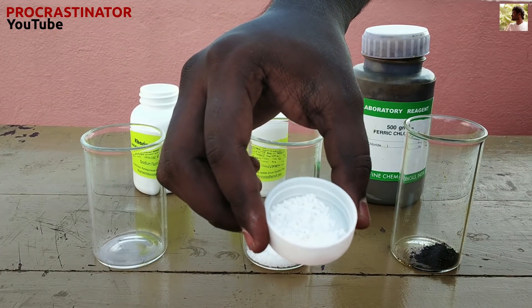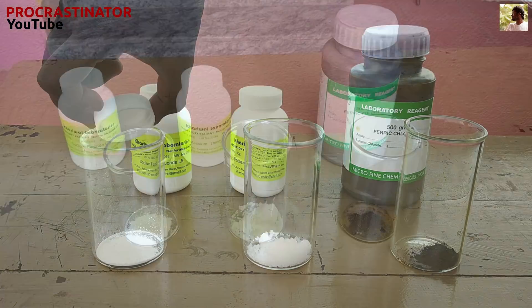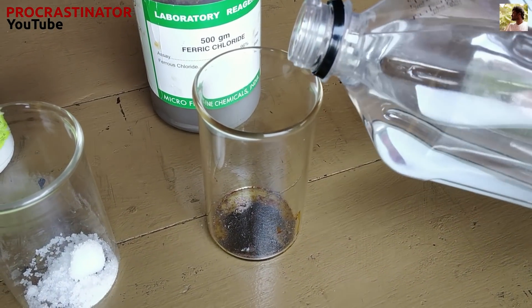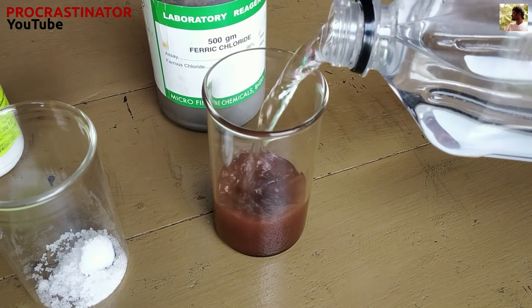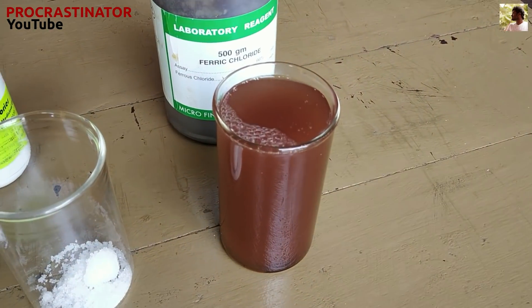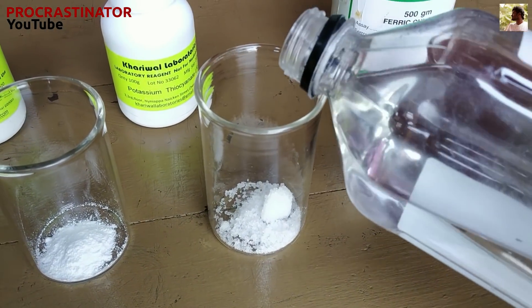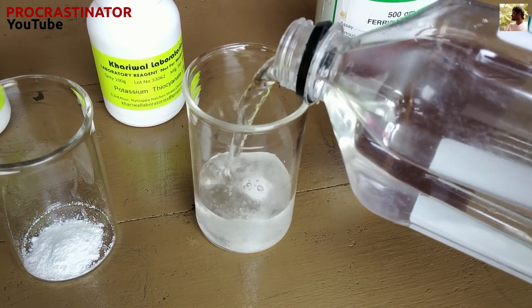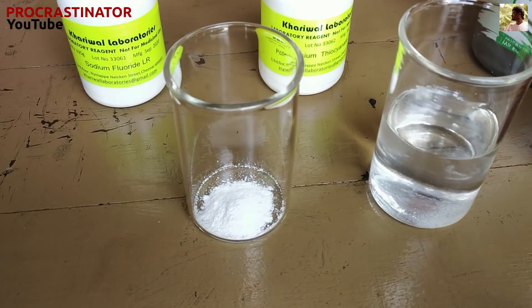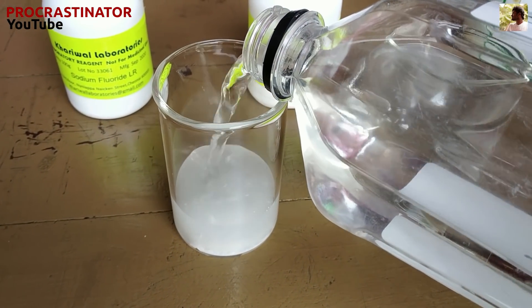Let's add to 3 containers. Let's add these containers. Let's put a few molecules in the first container. We'll put the ferric chloride and potassium thiocyanate, then add the sodium fluoride in the container and mix.